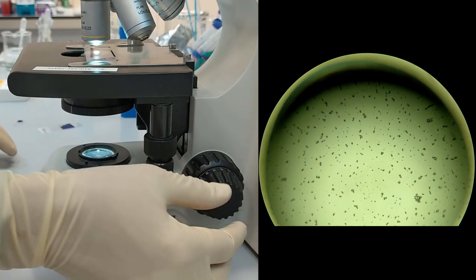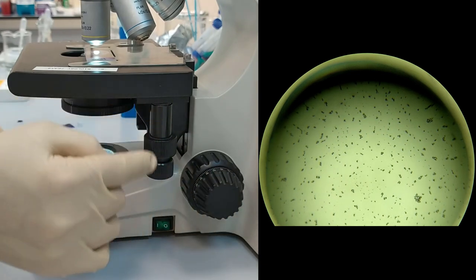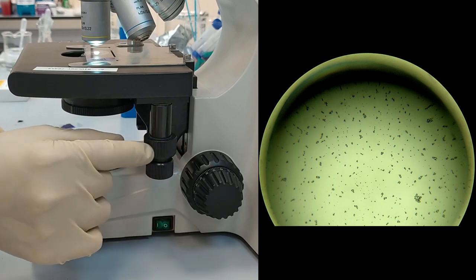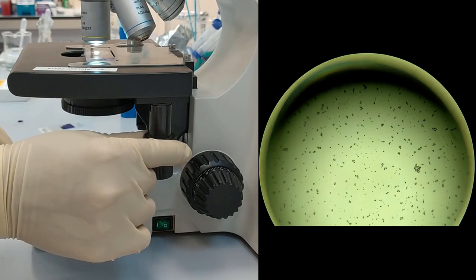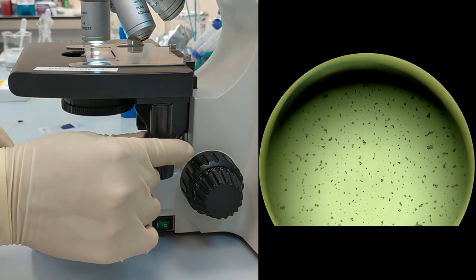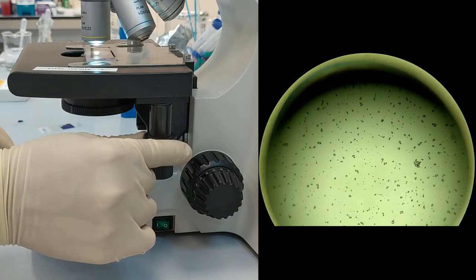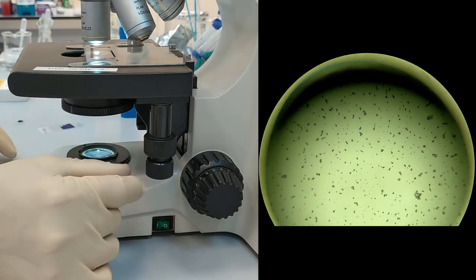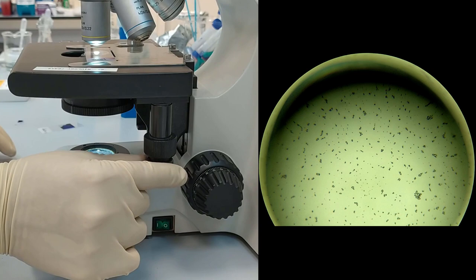We can use the stage controls, so the upper ring moves the stage in the y-direction and the lower one moves it on the x-axis.